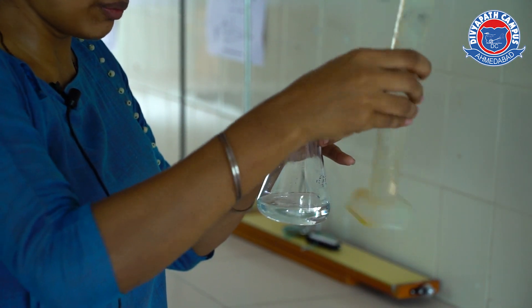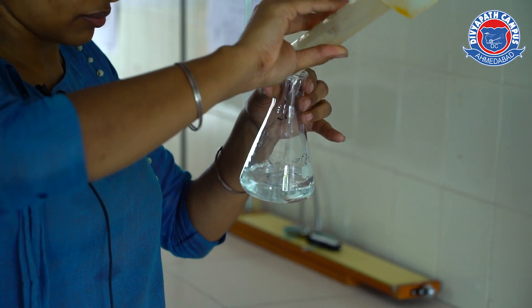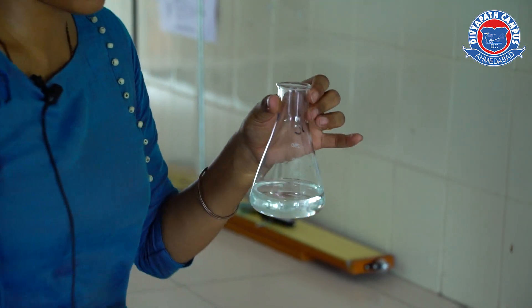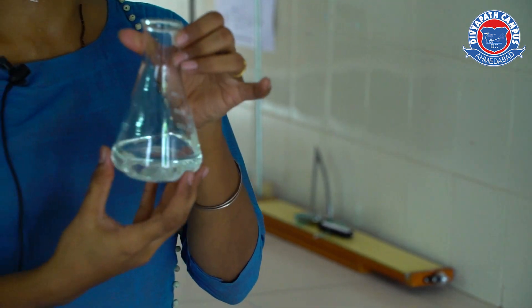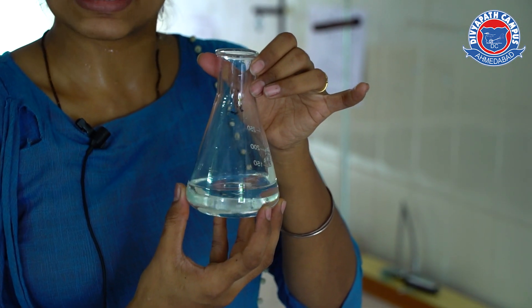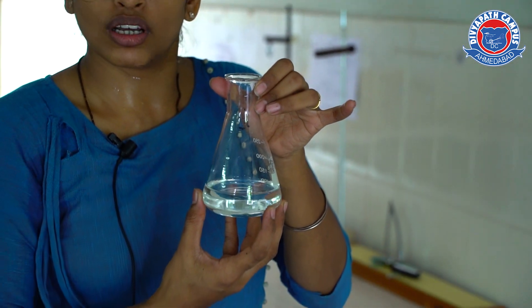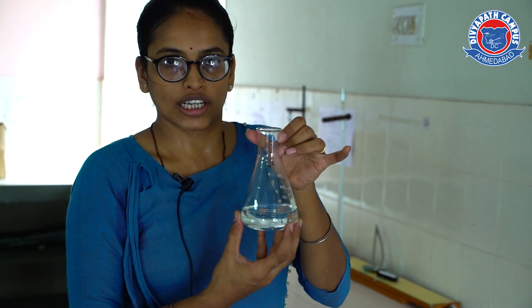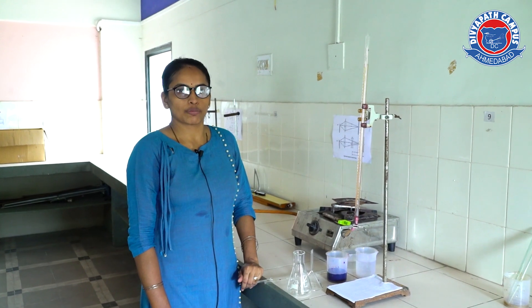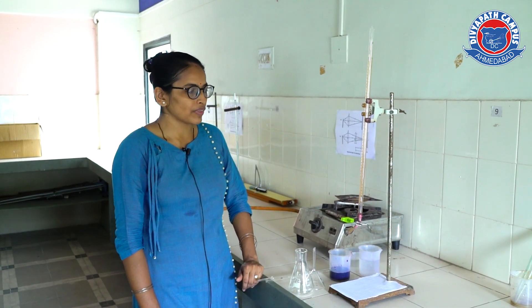Now we will mix it properly. This is the solution — we call it a standard solution with 0.1 molar molarity. Thank you. Now, to find out the molarity of the KMnO4 solution, we have to do titration.